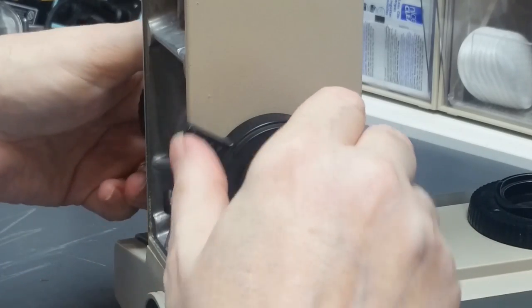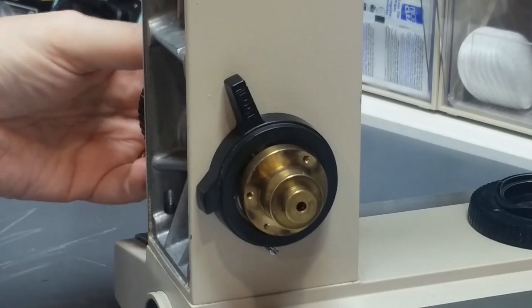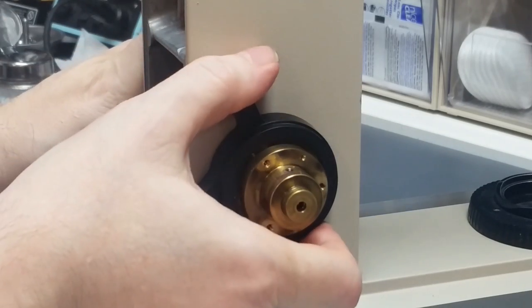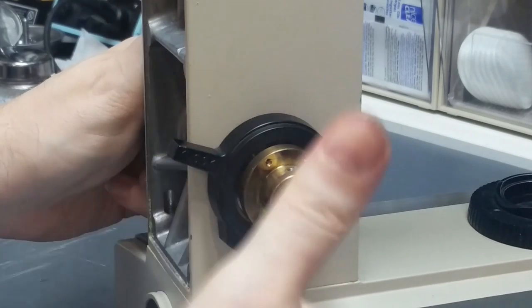Let's do this again. Lock it, make sure it'll move this direction but not that direction. Rotate it a quarter of a turn and unlock and listen for the slap. Perfect.